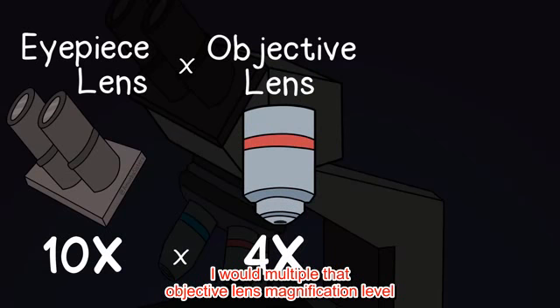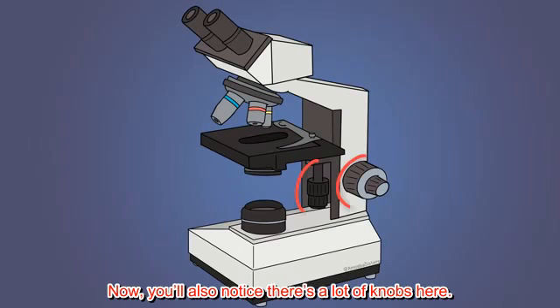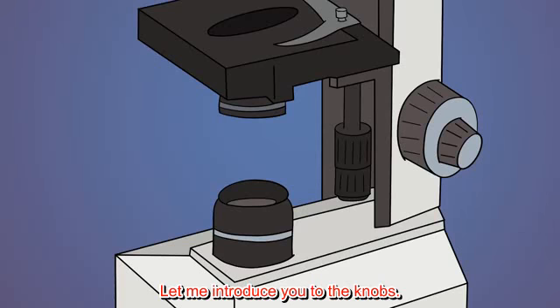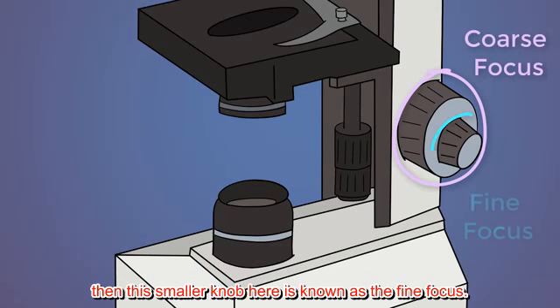I would multiply that objective lens magnification level by the eyepiece lens magnification level so that my total magnification is 40 times. Now, you'll also notice there's a lot of knobs here. Let me introduce you to the knobs. This large knob here is known as the coarse focus, and then this smaller knob here is known as the fine focus.